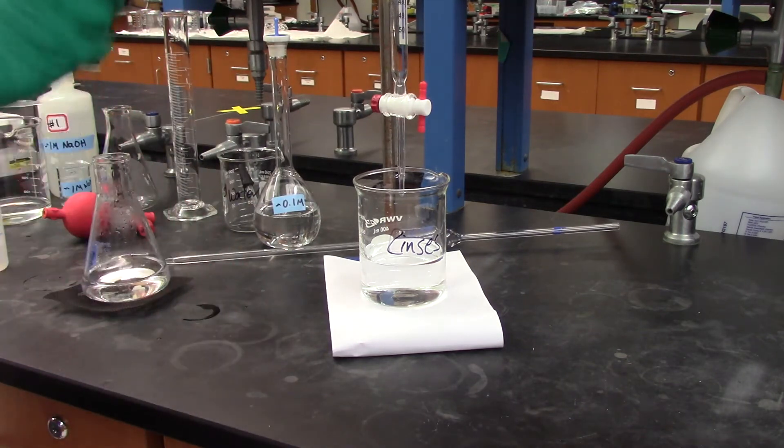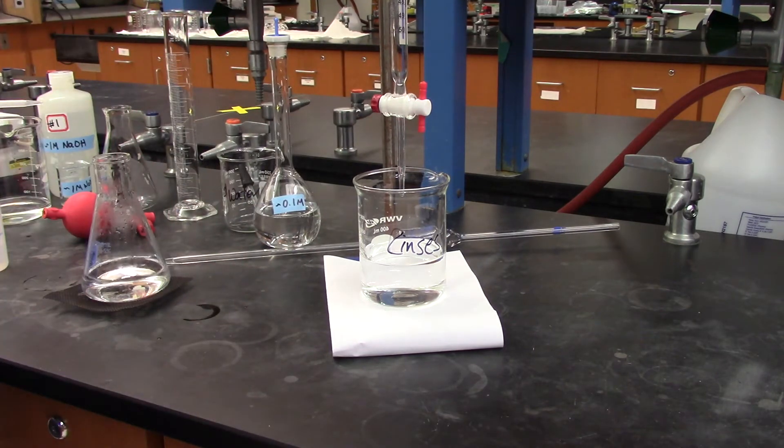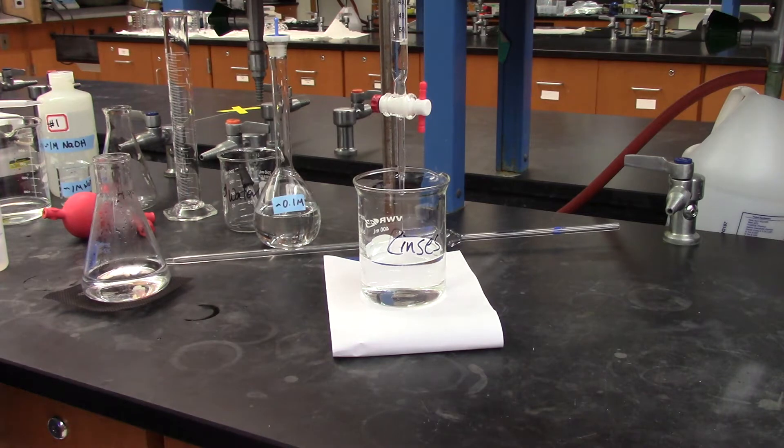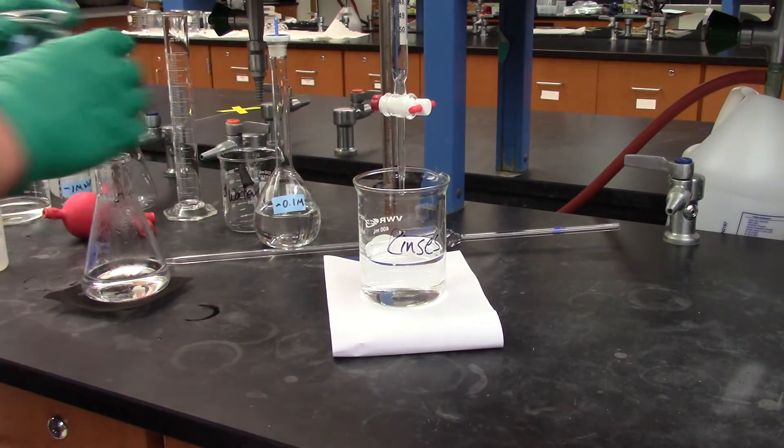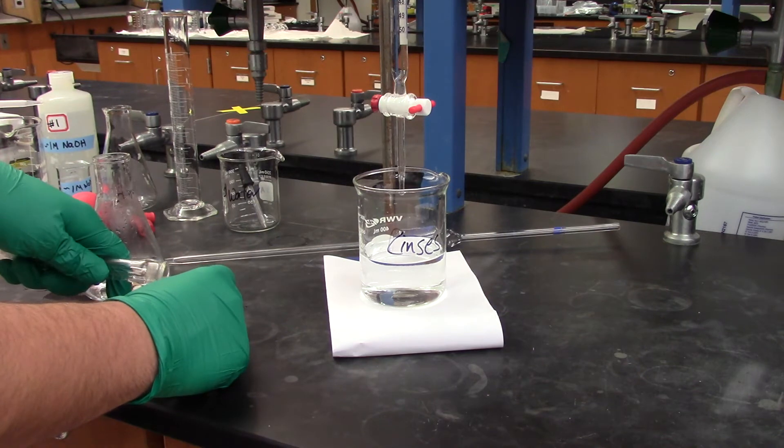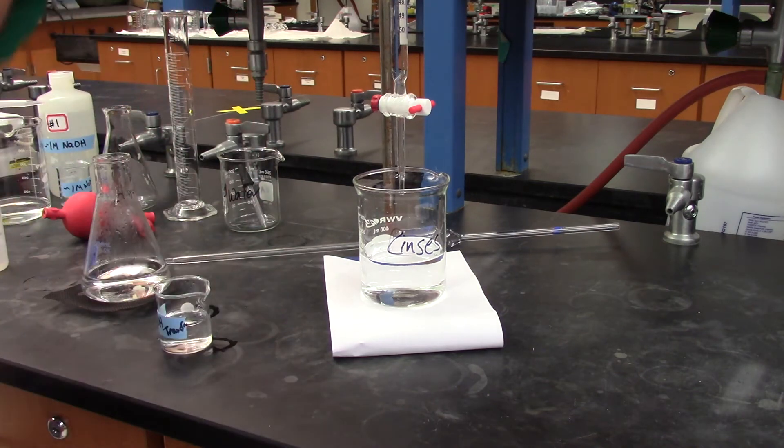Okay, so that's one rinse, the second one through, and I will top it off with my solution. So this is preparing the burette for your titration.